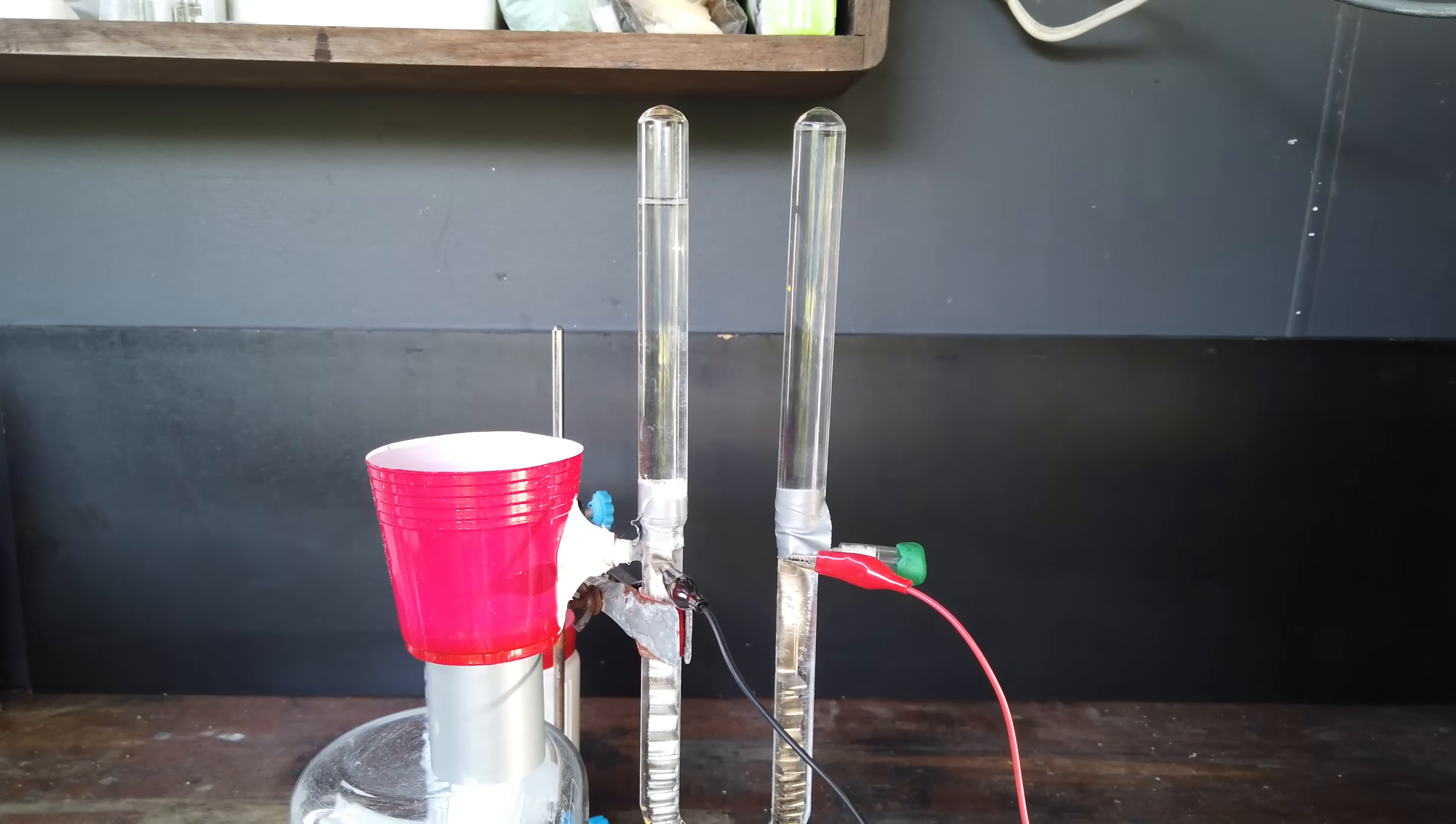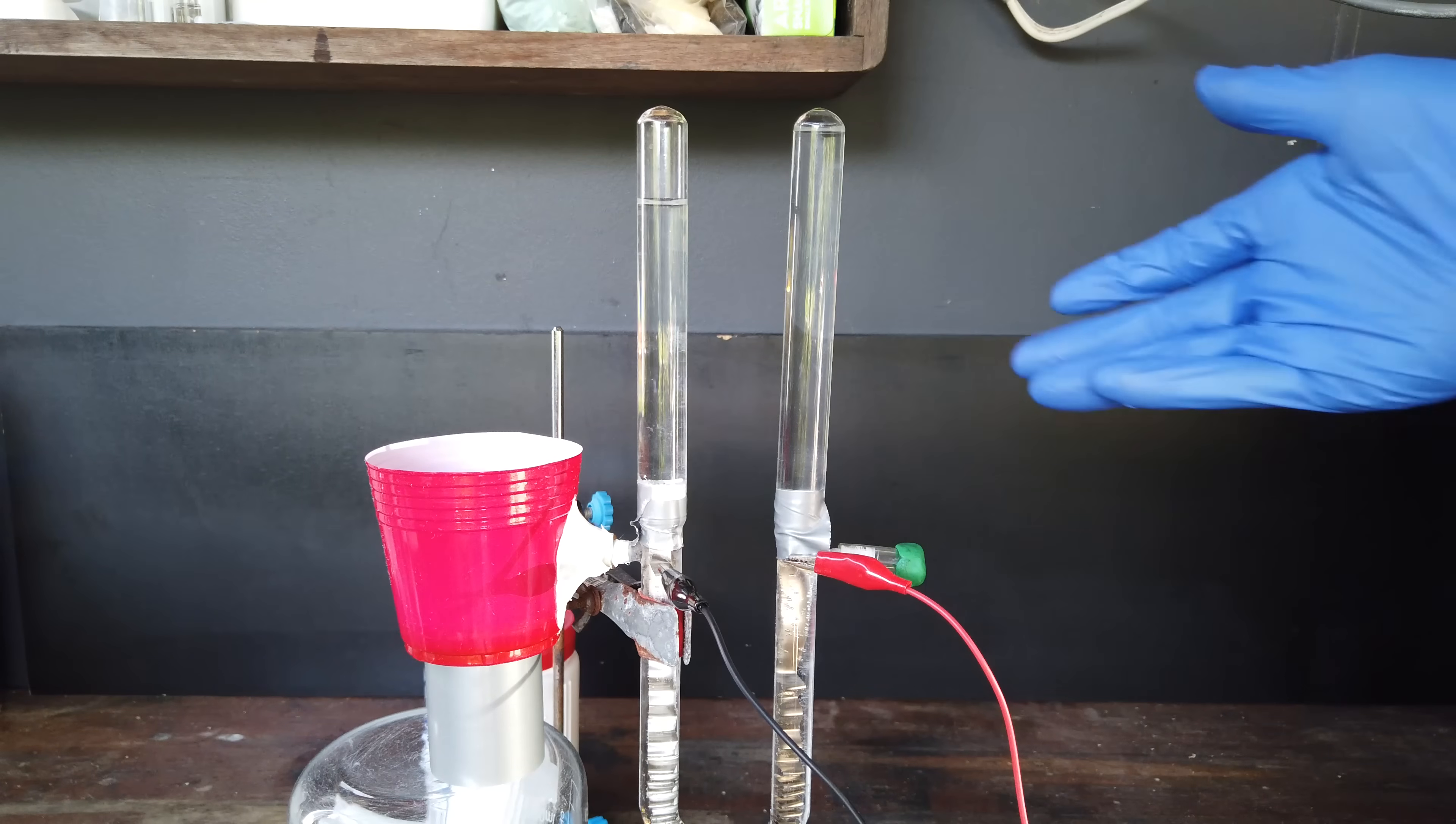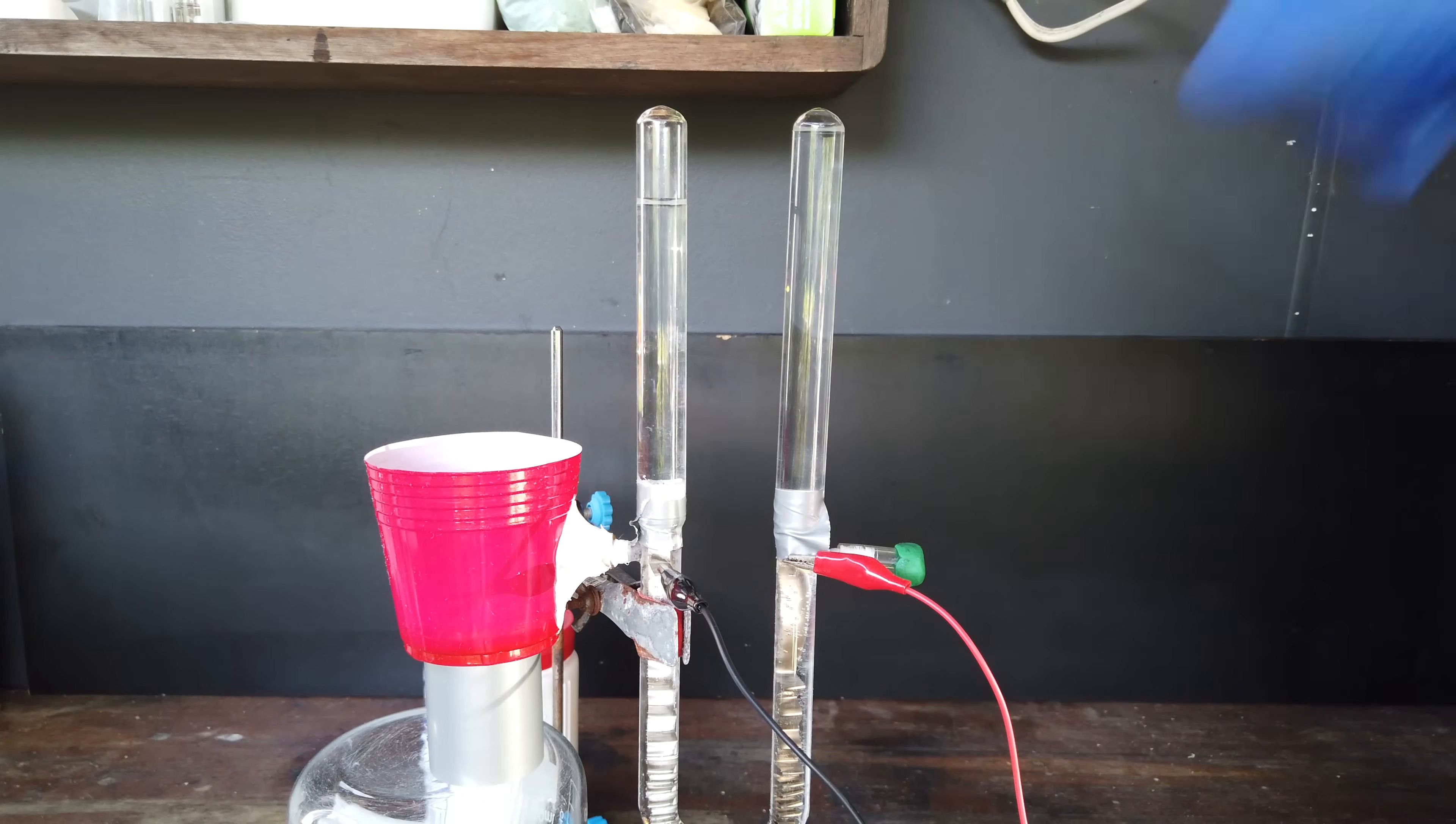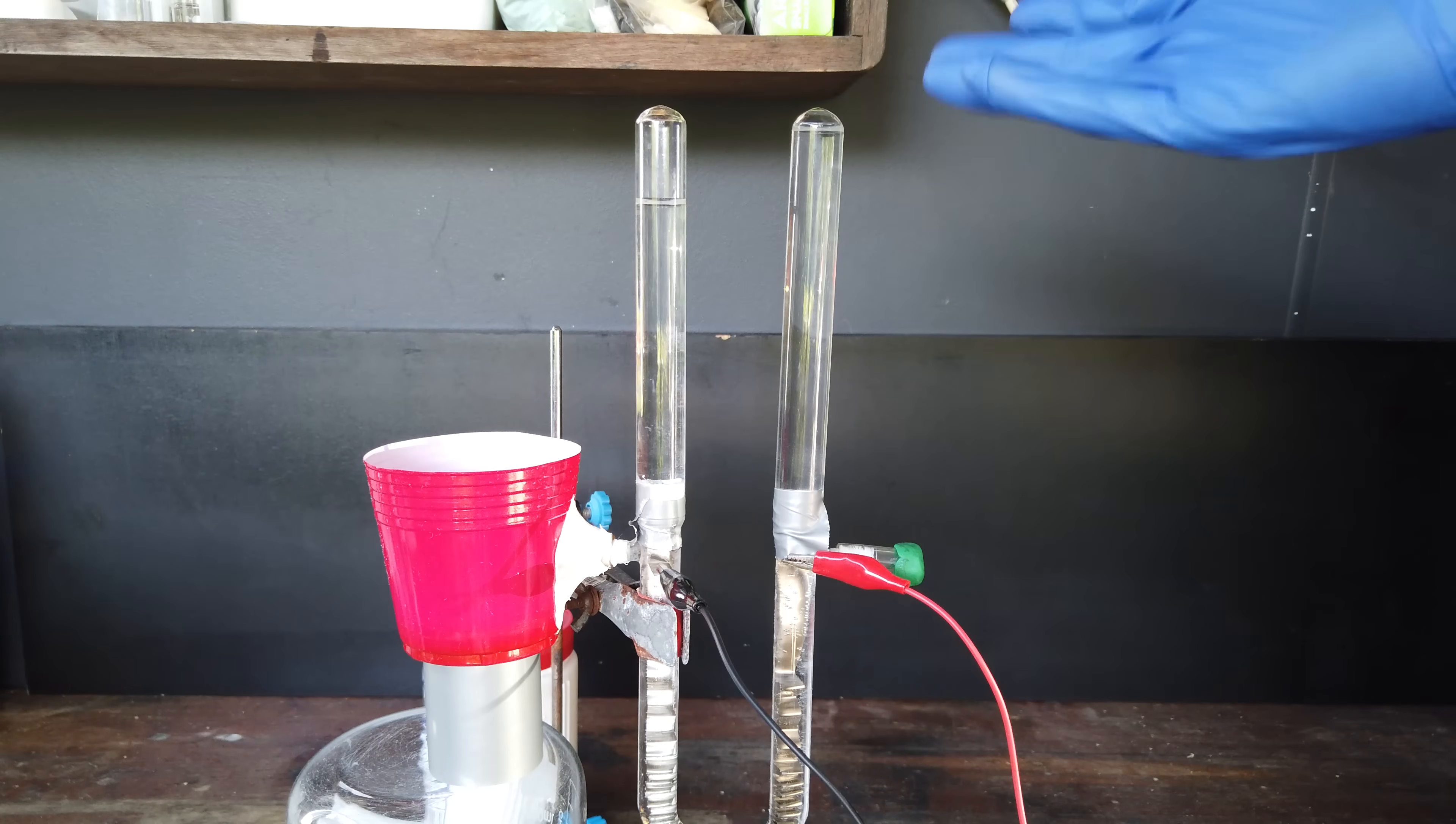Anyway, I was going to run this experiment until we had a test tube full of nitrogen gas and then demonstrate that it's nitrogen and not oxygen by attempting to do the glowing splint test and show that it doesn't relight a glowing splint. But from the fact that it's going to take around a month to fill up this test tube with nitrogen gas, you know, am I going to wait a month to fill up a test tube with fancy air? No, I'm not.